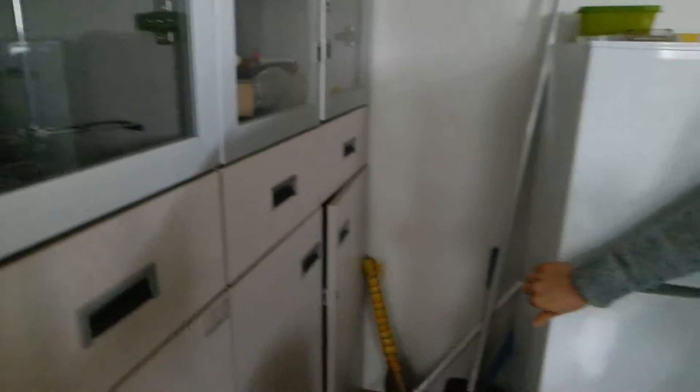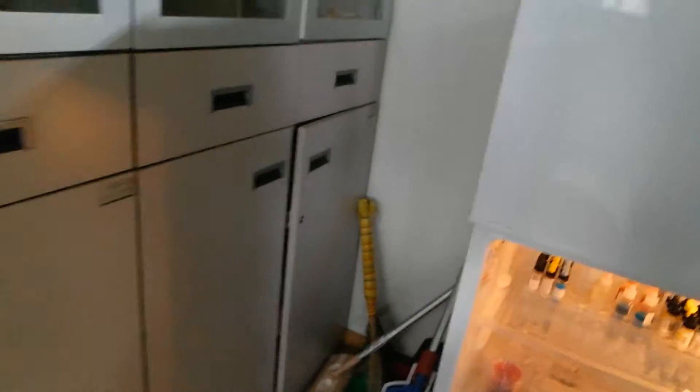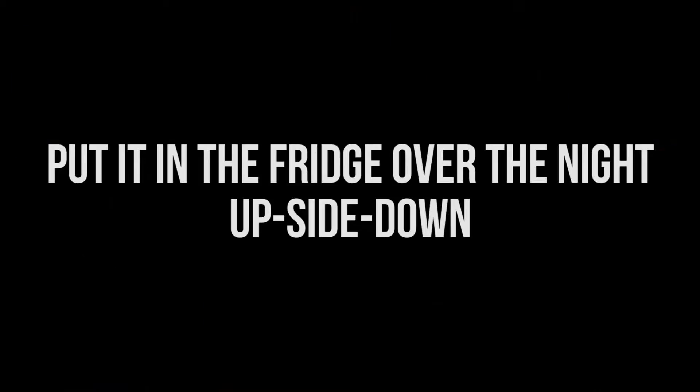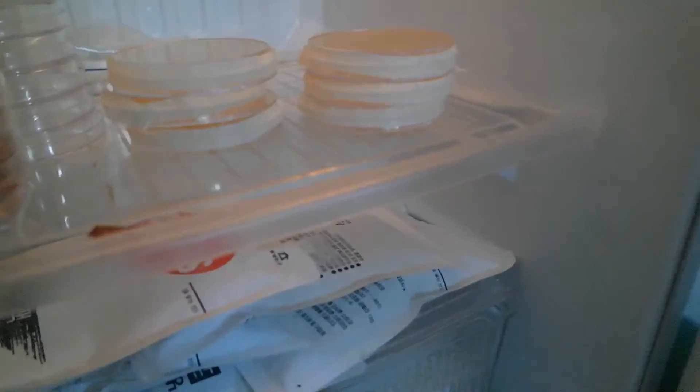Is this the first? What's that? It's an incubator. Incubator? Do we have an incubator? Yeah, we will be incubating this.